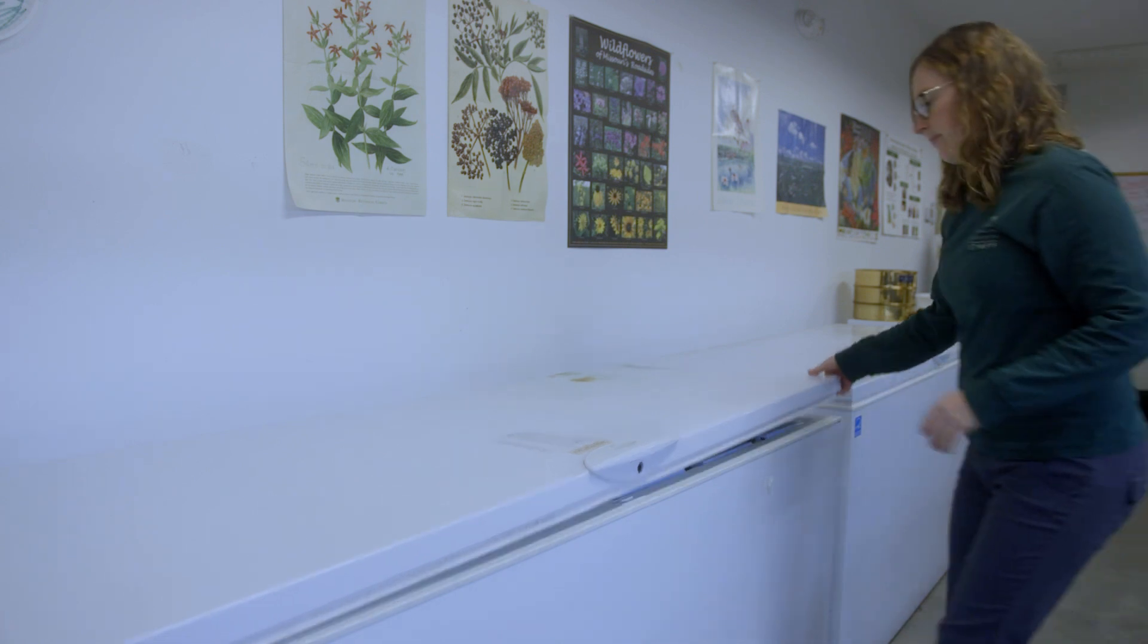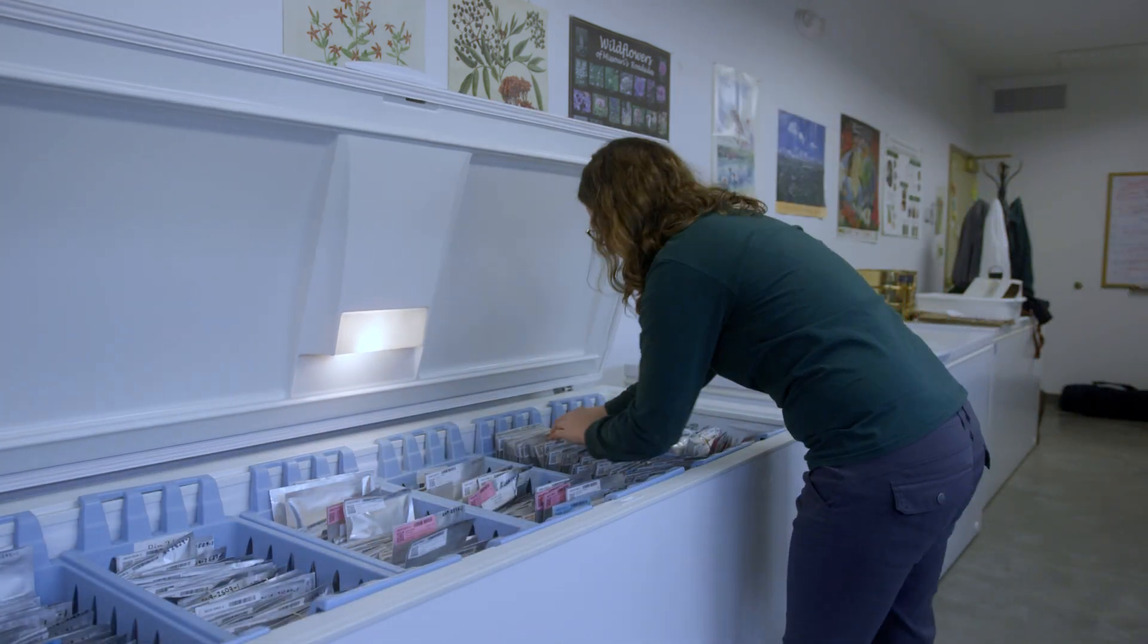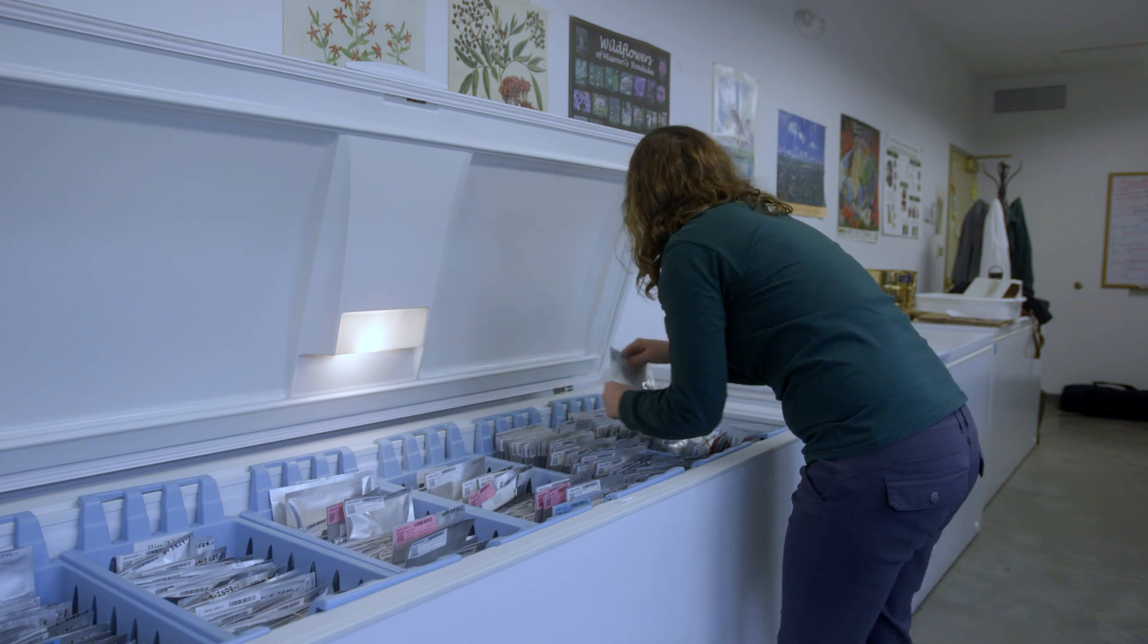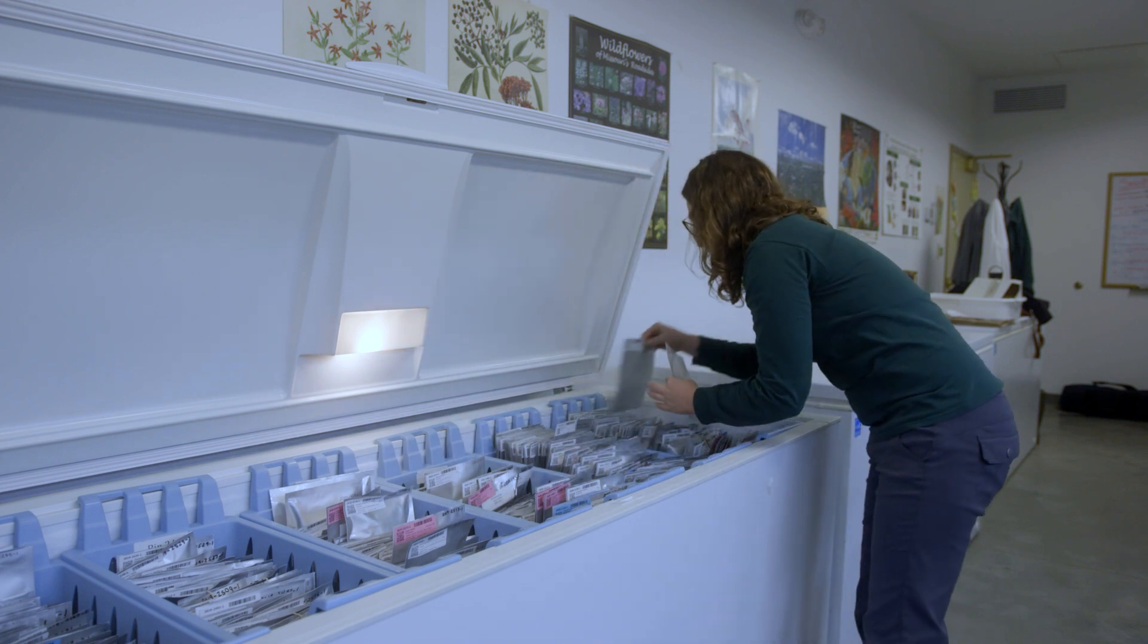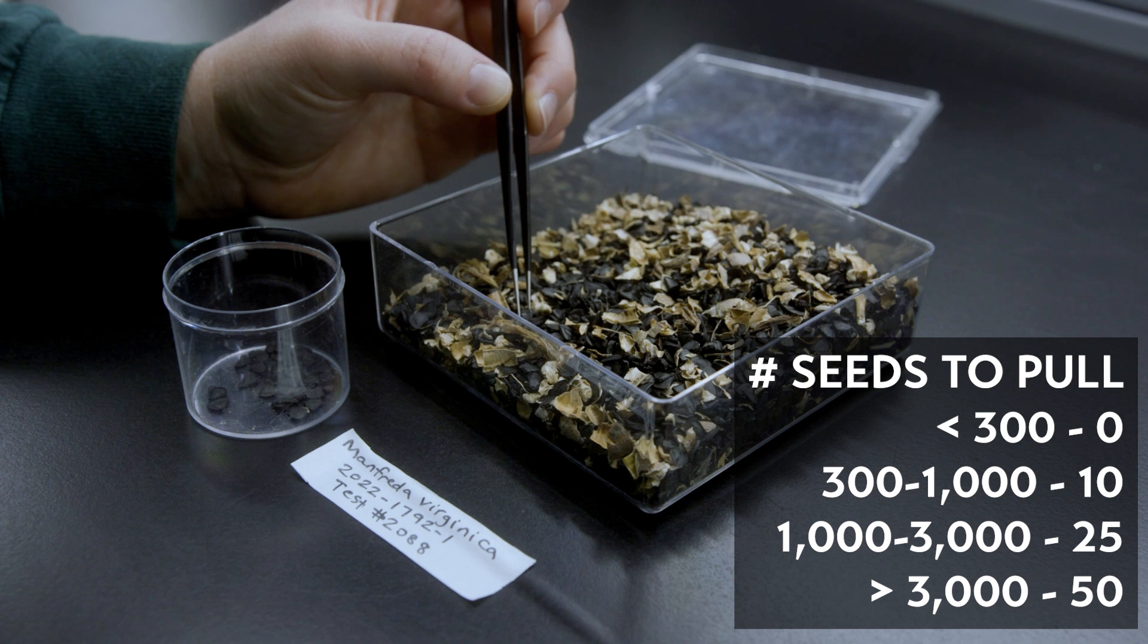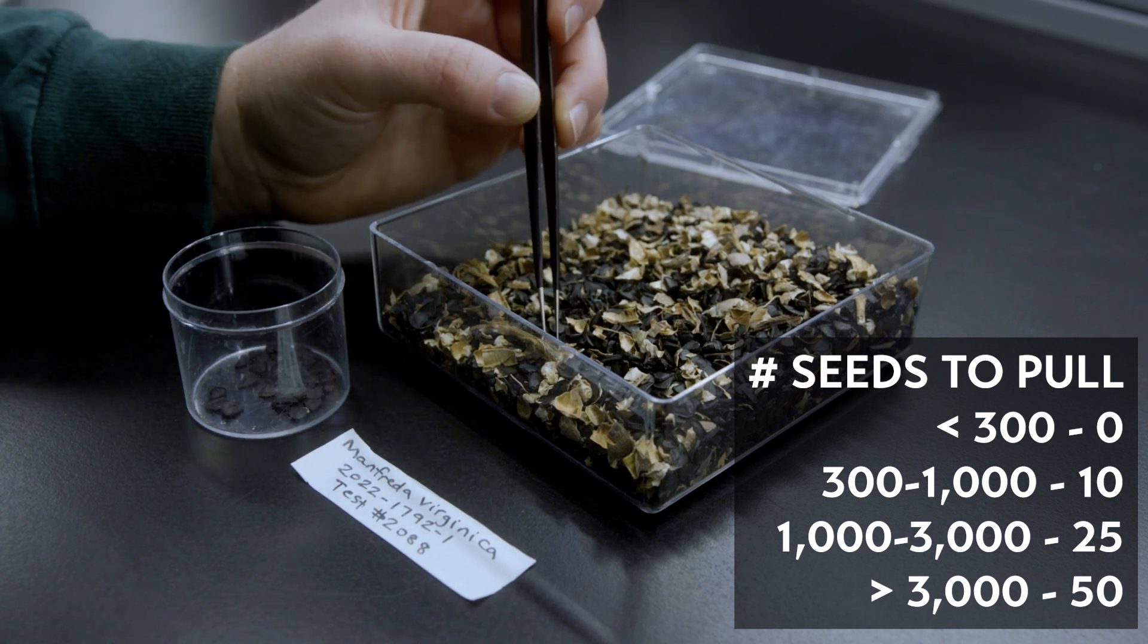The first decision I make is what seeds need to be tested. We test our seeds fresh, after one year of storage, and then every five years after that. We'll pull 10, 25, or 50 seeds based on the total number of seeds in the collection.